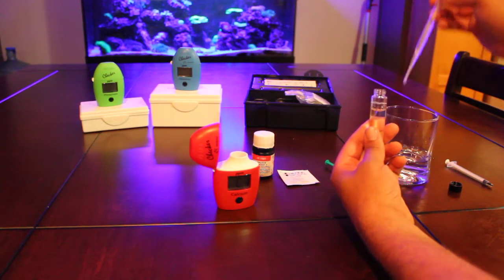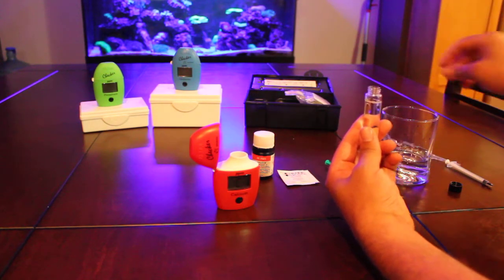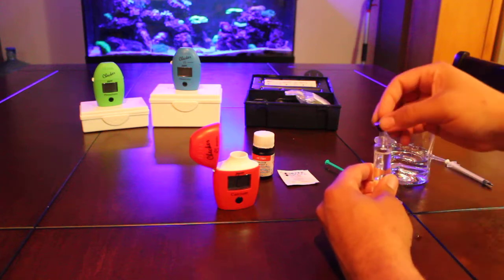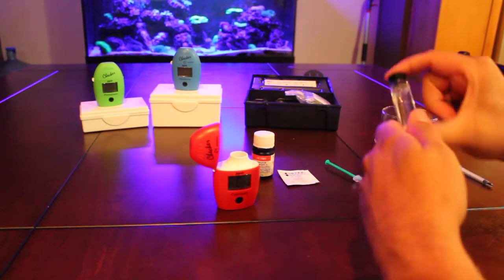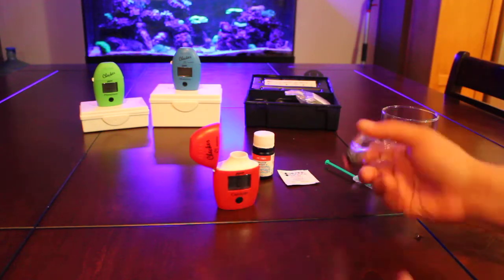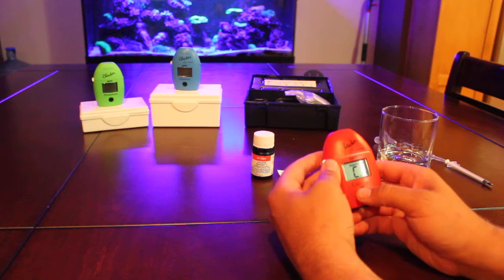On paper this test looks scary, once you figure it out, it's pretty quick and easy. Okay, RODI water is in. Toss and turn. And press.